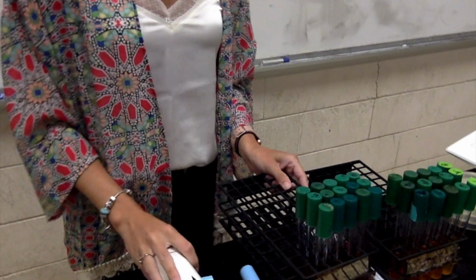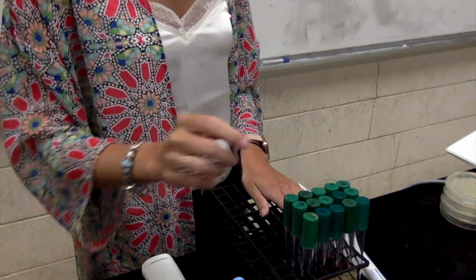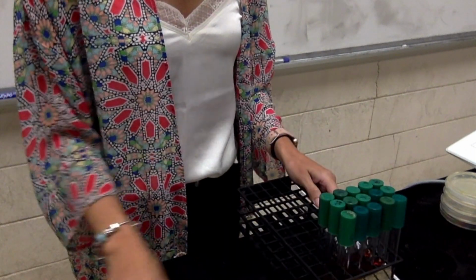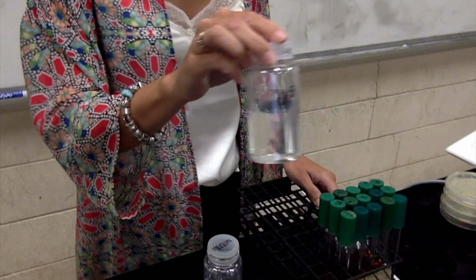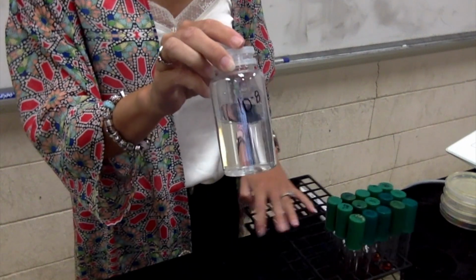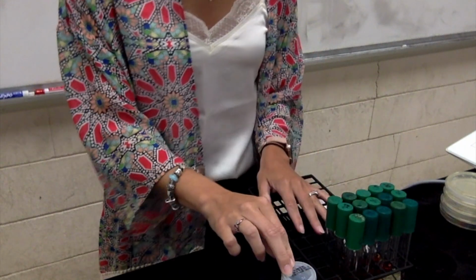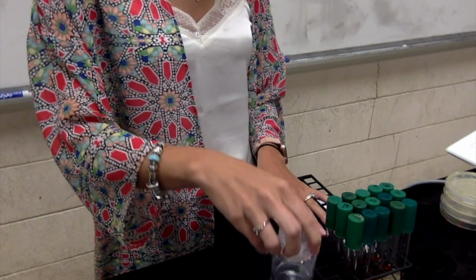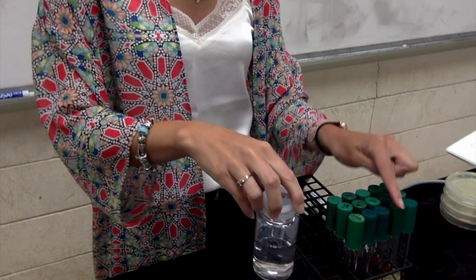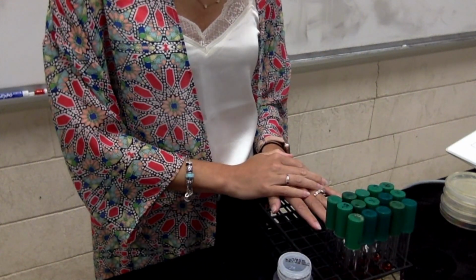So here is the results that I've already got here, so we're going to move those. So this is my MPN setup, and my 8, 9, and 10. So I have a 10 to the negative 8 dilution. Here's my 10 to the negative 8 that I've already made. I have my row for 10 to the negative 8, so I'm going to pipette 1 ml into each one of my tubes. I'm going to put my 10 to the negative 8 dilution into each one of these tubes, 1 ml, 1 ml, 1 ml, 1 ml, 1 ml, and we're going to see where it grows.